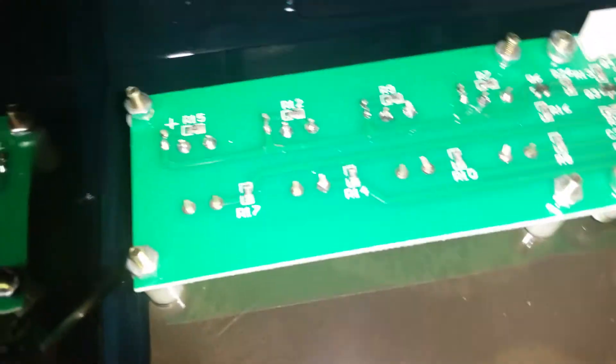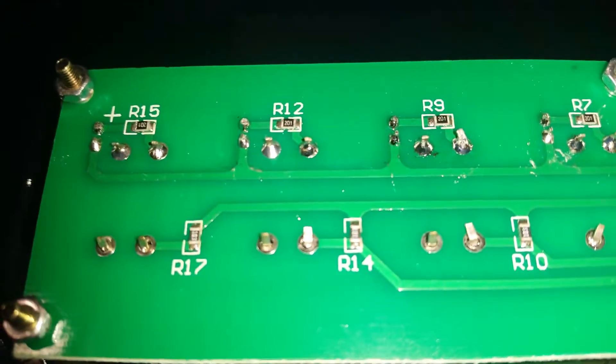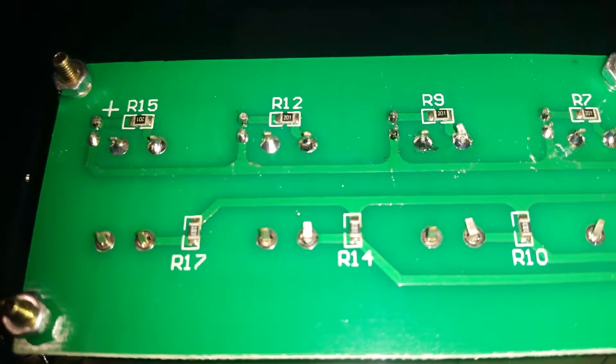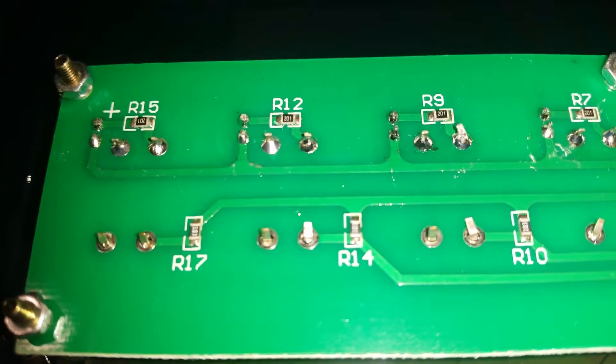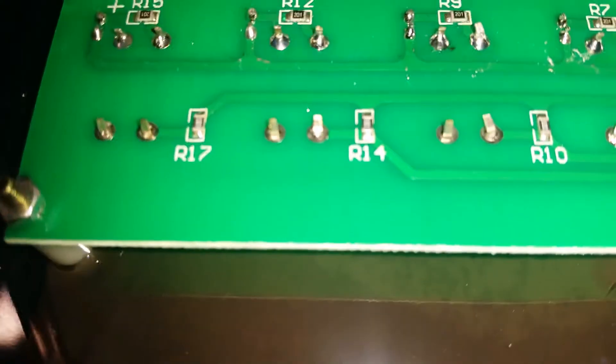The other thing I found is more poor solder work. Hopefully this will pick it up on this camera. If I angle it right. If you look at the top pins, they appear to be soldered properly. Domed solder built up.